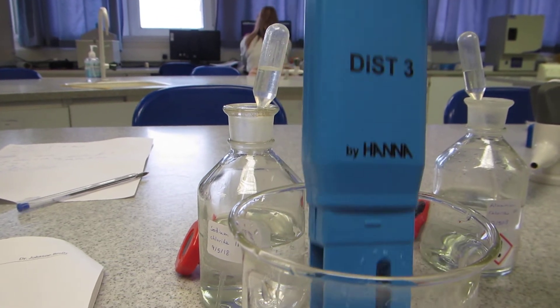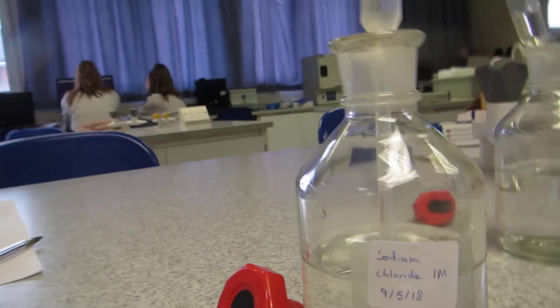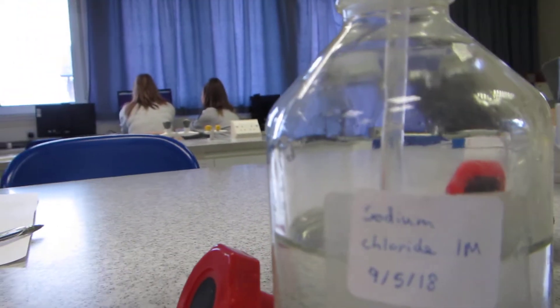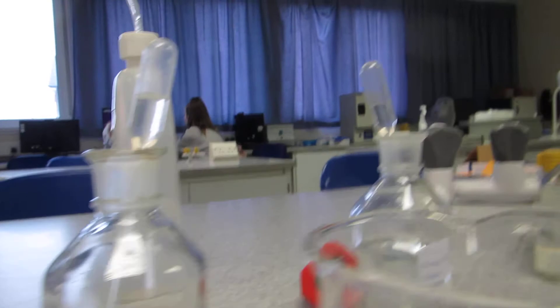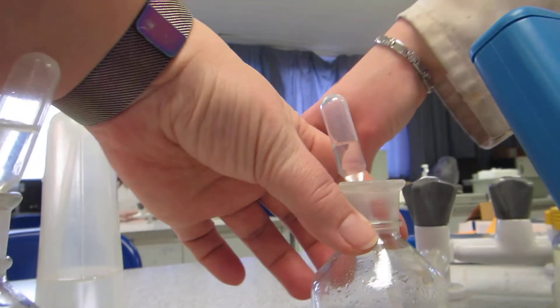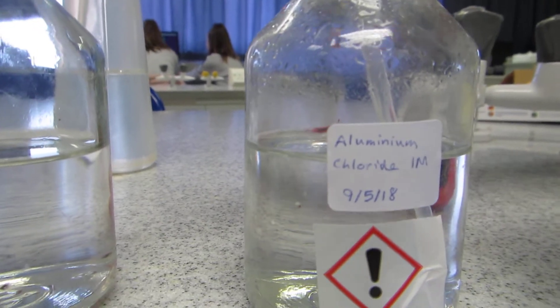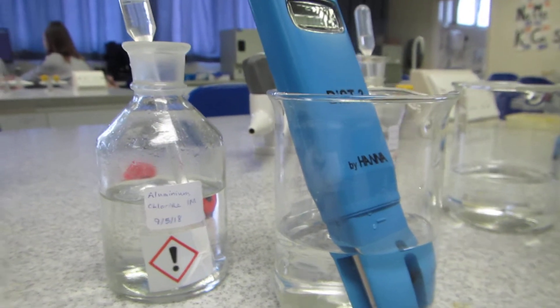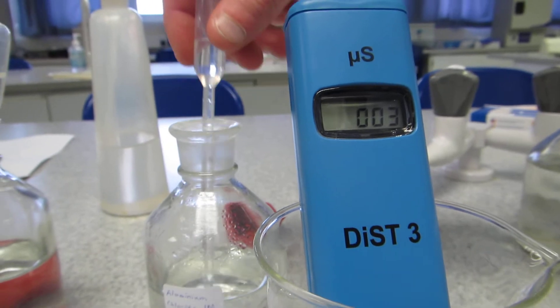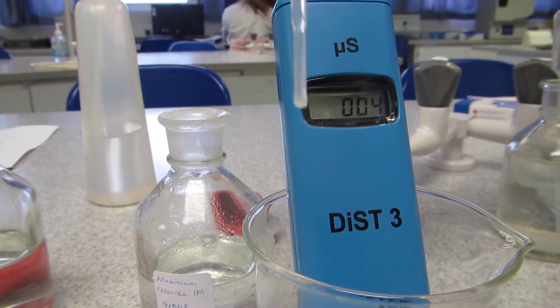Now I'm going to move on to the next one and do the same for aluminium chloride. I'll quickly rinse my electrode in deionized water over the sink and move on. Firstly, the measurement of our deionized water before I've added any drops of the aluminium chloride.